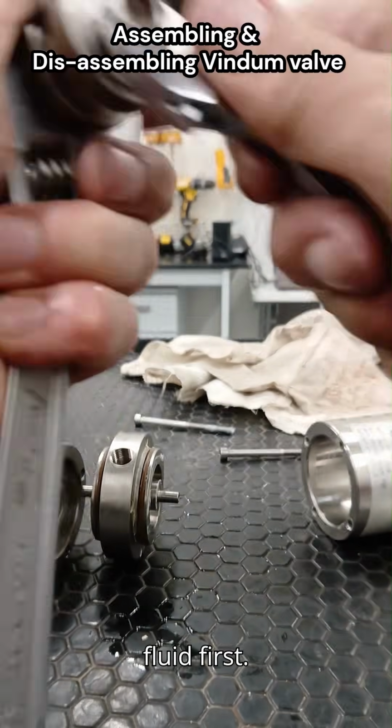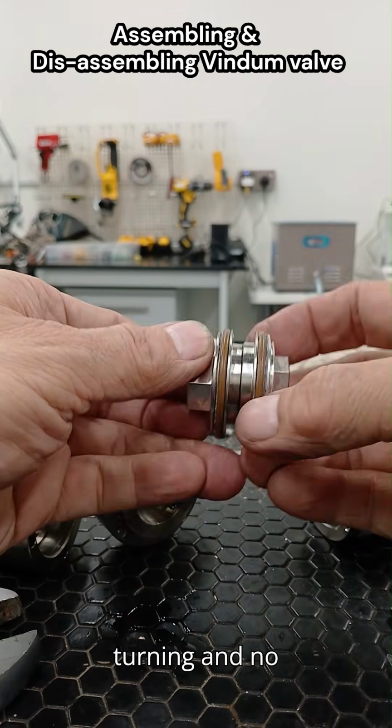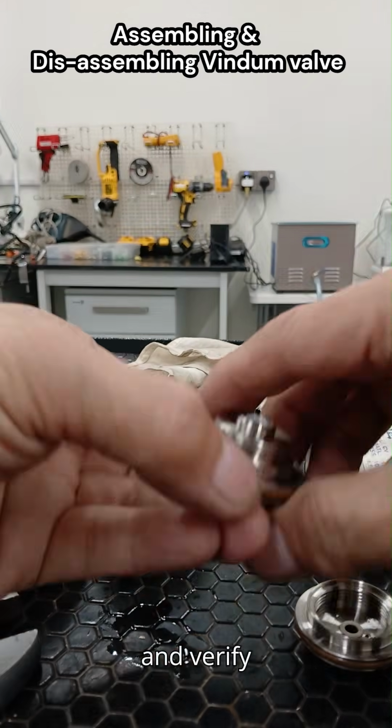Six, testing. Reconnect to the system with low-pressure fluid first. Operate through all positions to ensure smooth turning and no leaks. Increase pressure gradually to working level and verify performance.